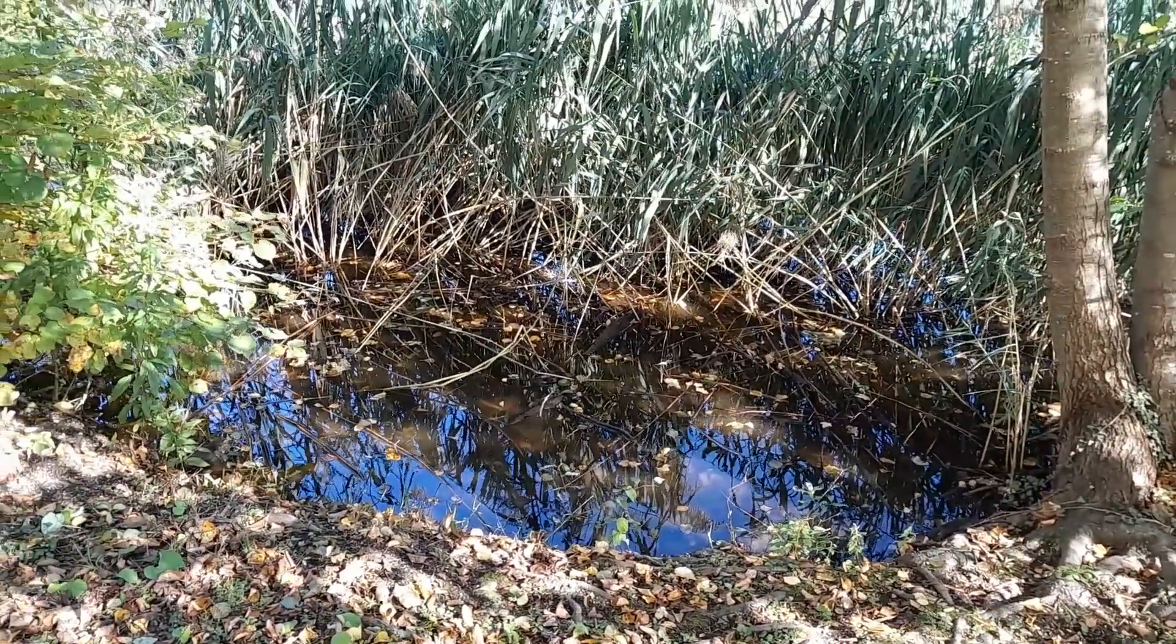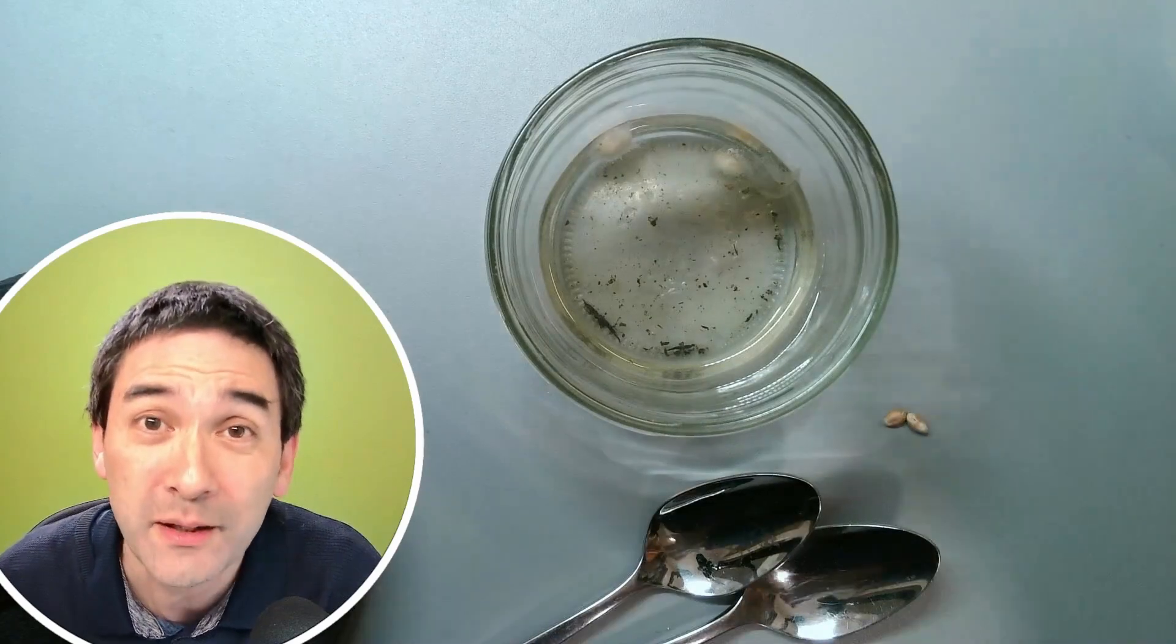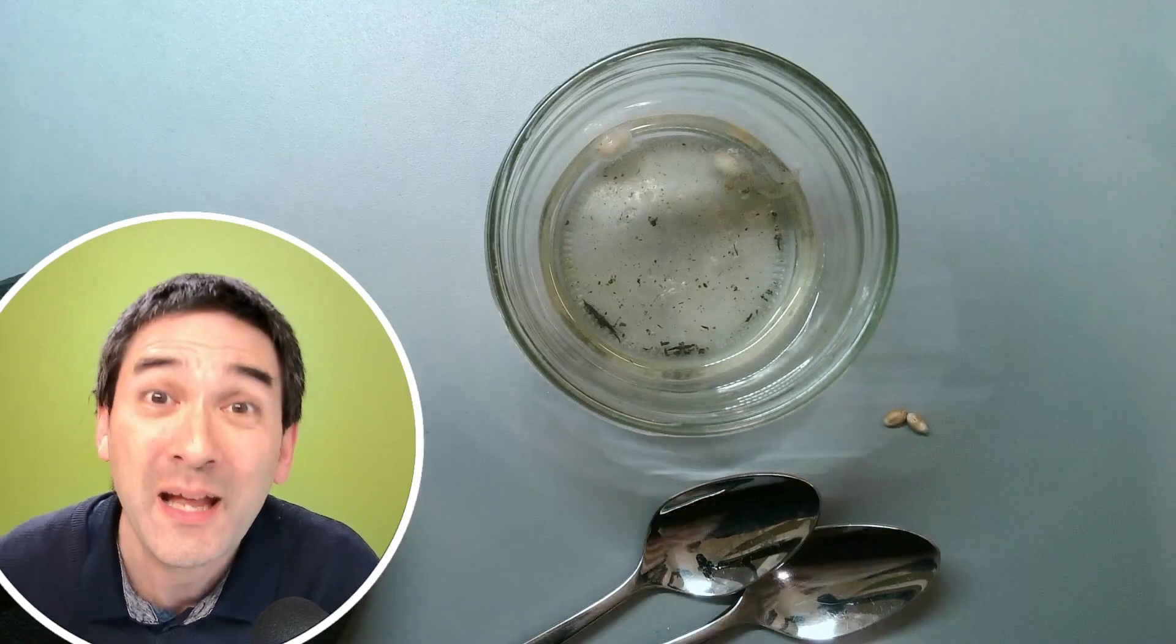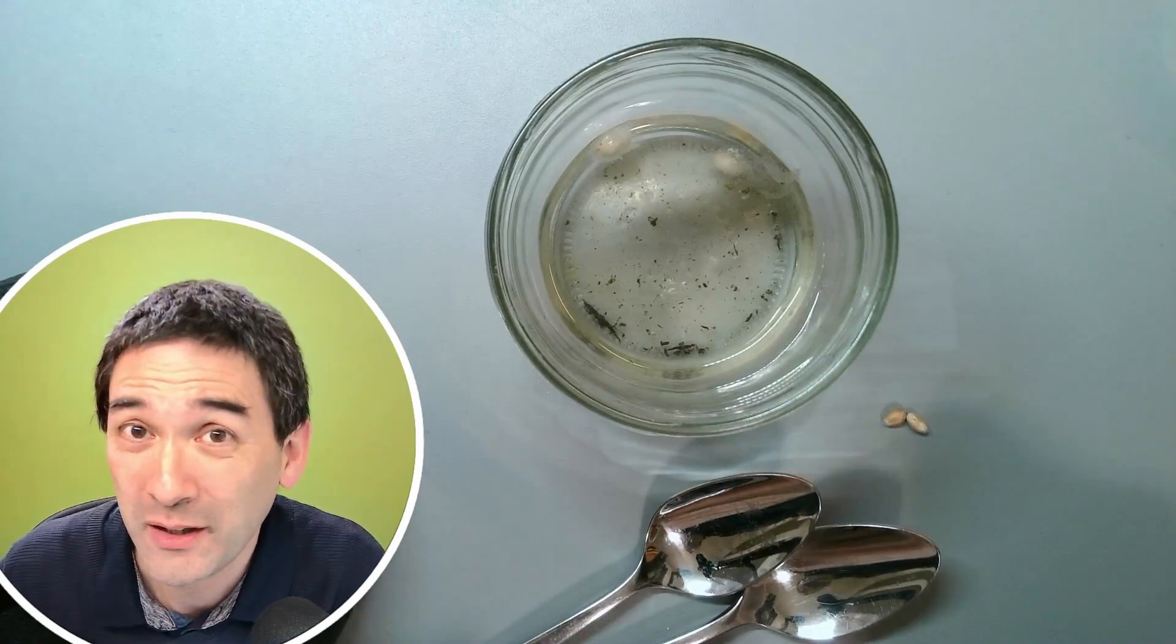So what you have to do is enrich them, grow them, breed them to a very high concentration so that they're more interesting to observe under the microscope. And this is what I have done, and I would like to show you how you can do that yourself.